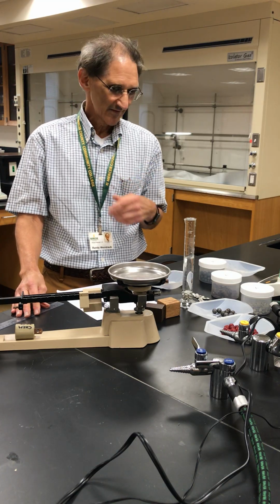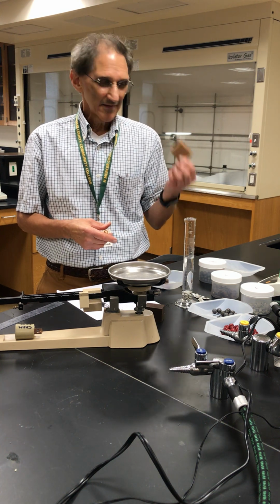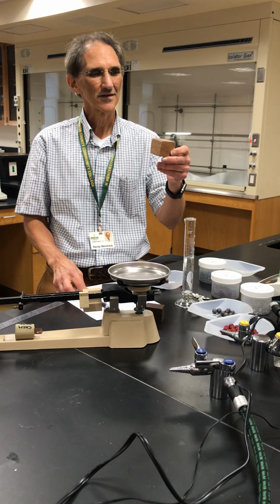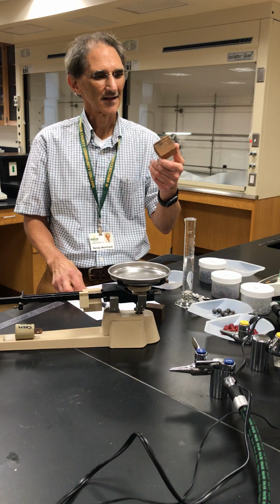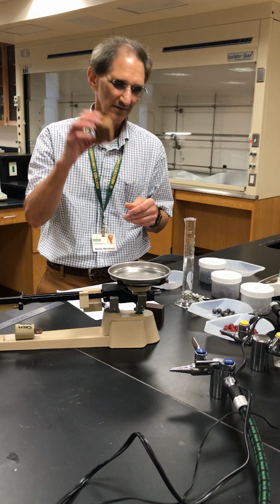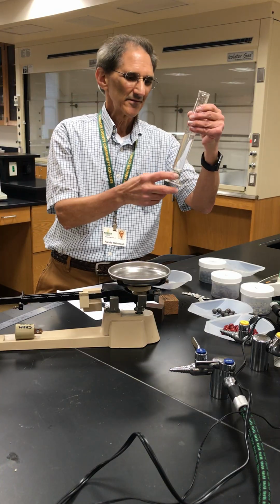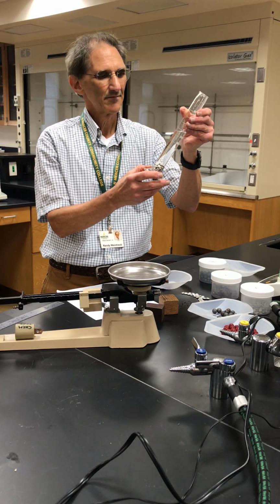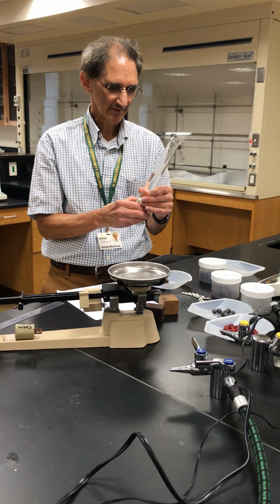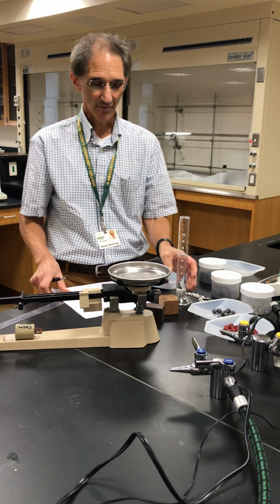Okay, so Archimedes came up with that. You might have heard of Archimedes' principle, because he went on to figure out that a material is going to be buoyant. Right? This wood block is going to float in water because it's got a lighter density than the water. So the water is pushing up and makes it float. Archimedes' principle. Okay, so we just determined the volume of these pellets of aluminum. Before that, we measured the mass of those. So we have mass and volume of this. Now we can calculate the density. Okay, so I recorded those data.